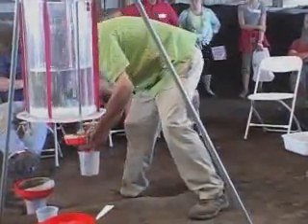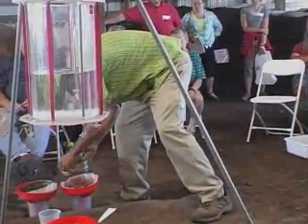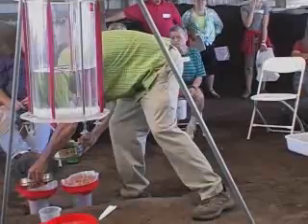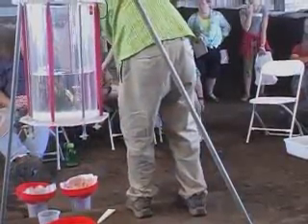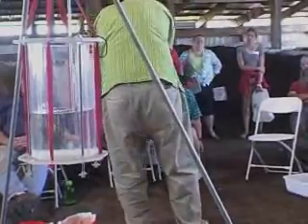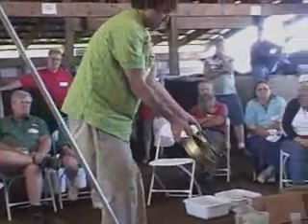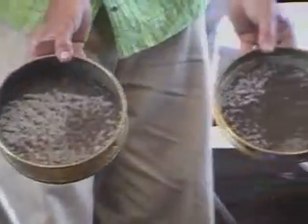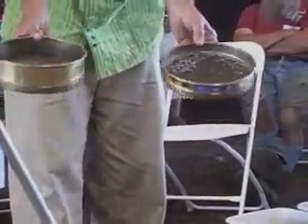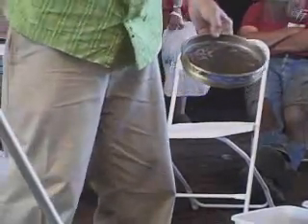The big idea is that we can change soil properties. This is just a demonstration, but you can see very clearly that we get different numbers. I love it as a demo because it kind of shows that this soil just doesn't have those glues.